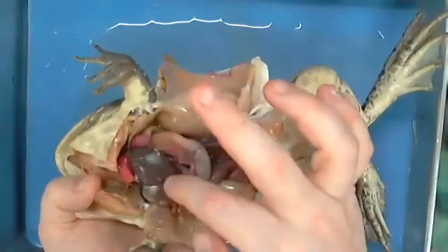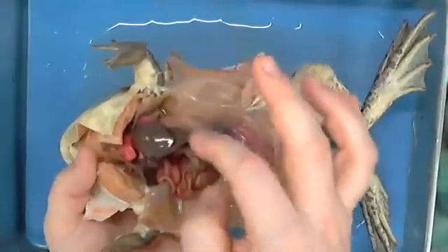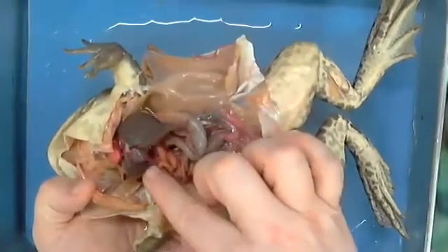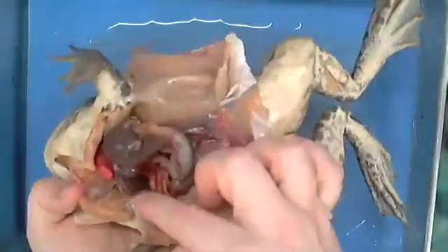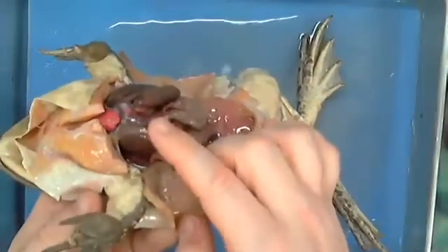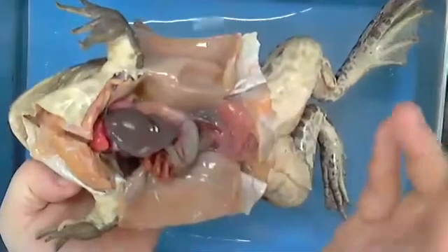Notice that it has multiple lobes. So you can see the lobes. Here's one that's here. Here is another one that happens to be here. Here is, in this case, a third one that is also right here. I'll turn it this way, so you can see all of these lobes that exist as part of this liver. So the liver's dark, you won't miss it.